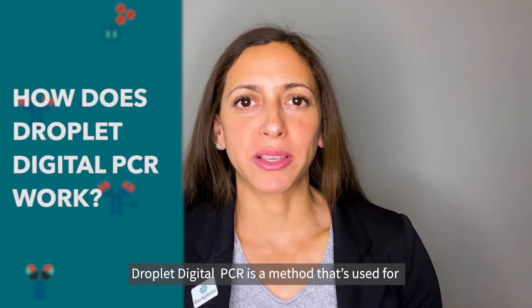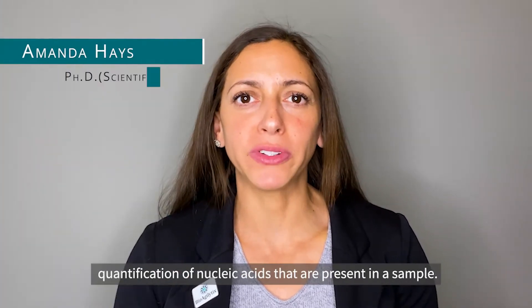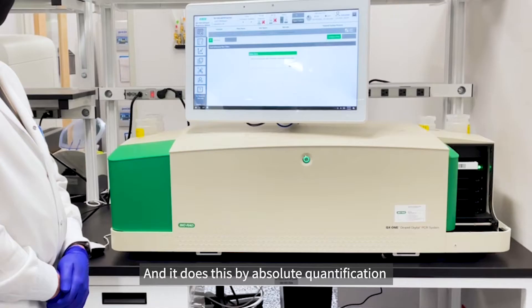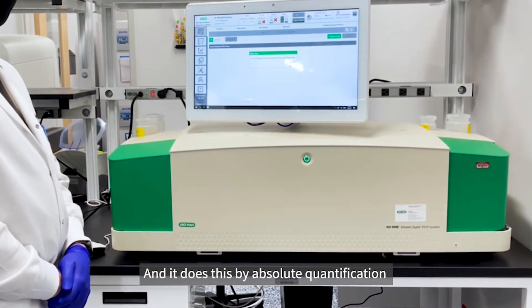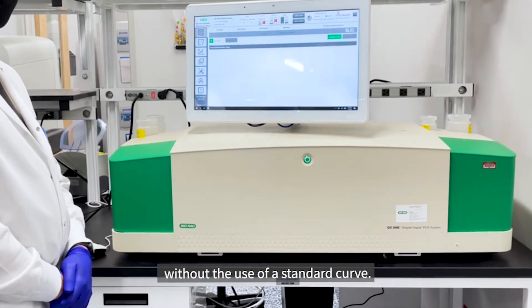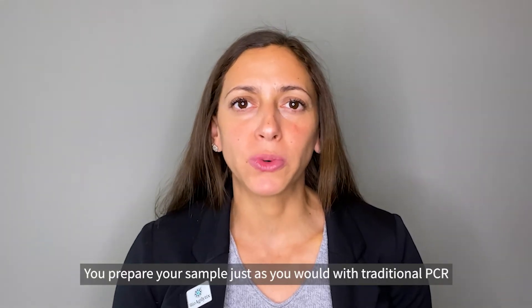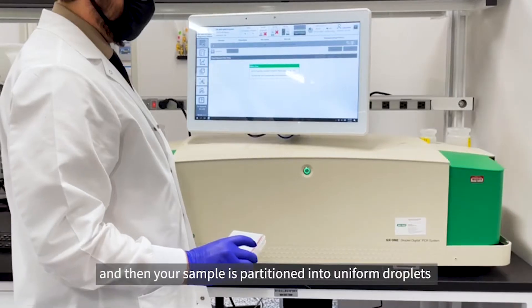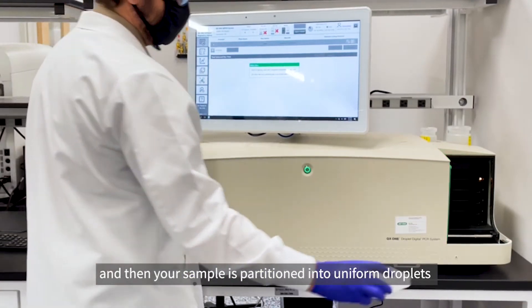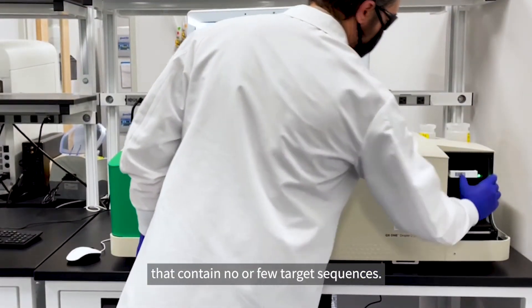Droplet digital PCR is a method used for quantification of nucleic acids present in a sample, and it does this by absolute quantification without the use of a standard curve. You prepare your sample just as you would with traditional PCR, and then your samples partition into uniform droplets that contain no or few target sequences.